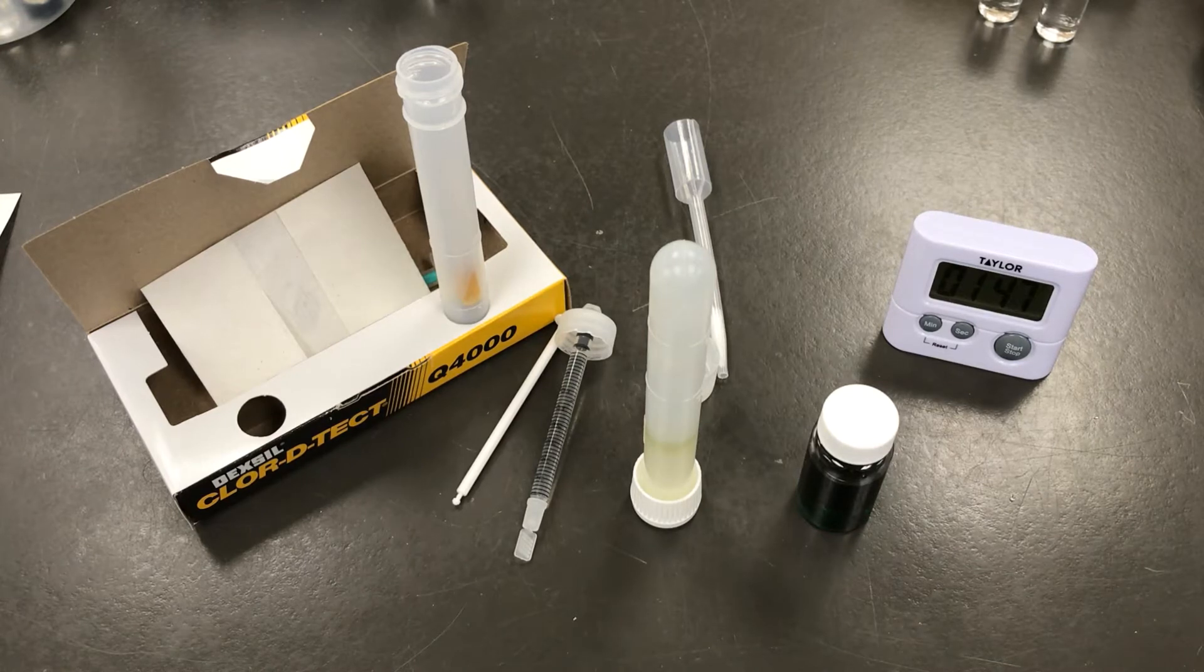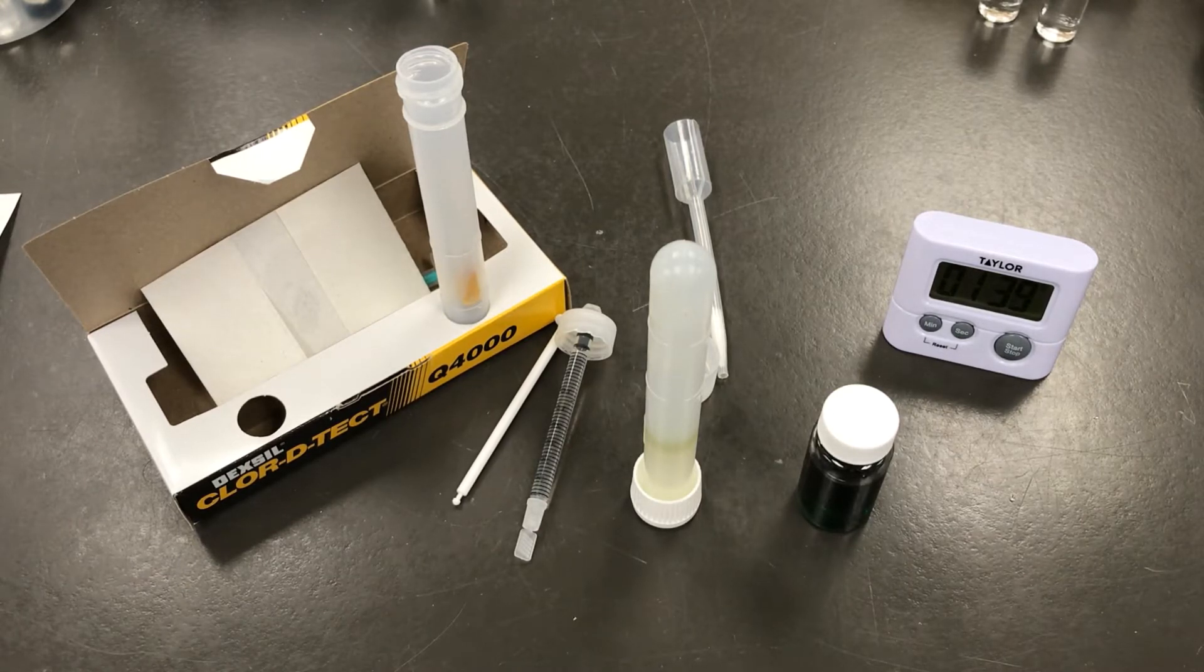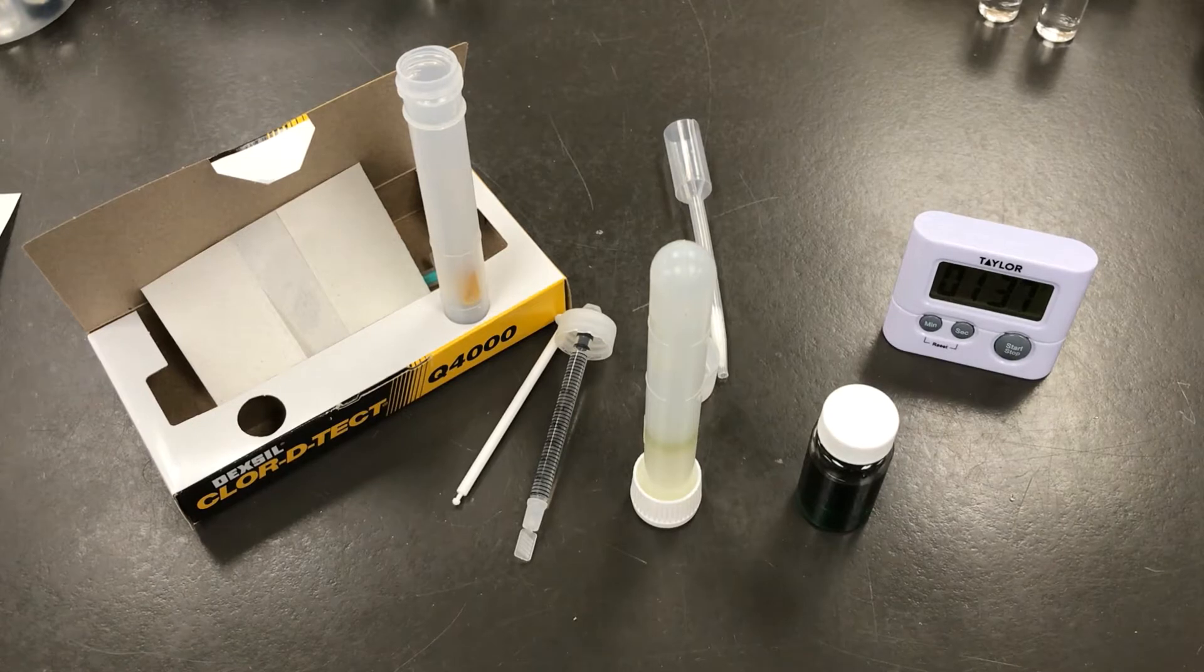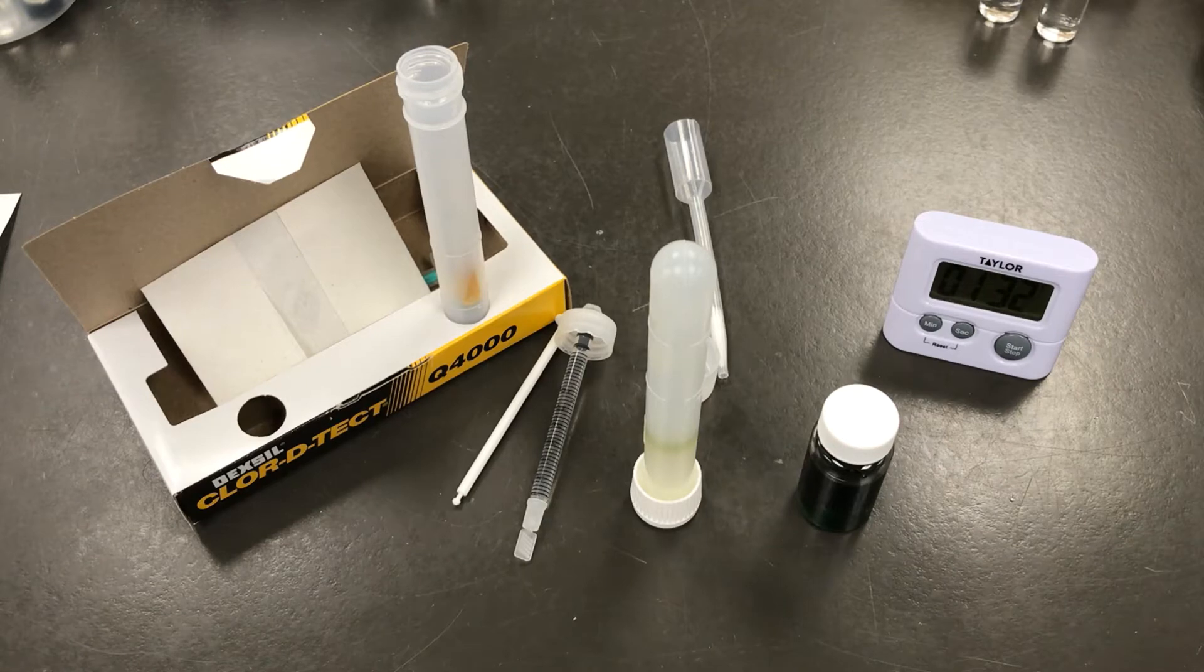During this 2 minute wait, you'll notice that the contents of the test tube will separate into two phases. The top phase is an oil phase and the bottom phase is an aqueous phase. Making the distinction between the two phases will be important in the next step.